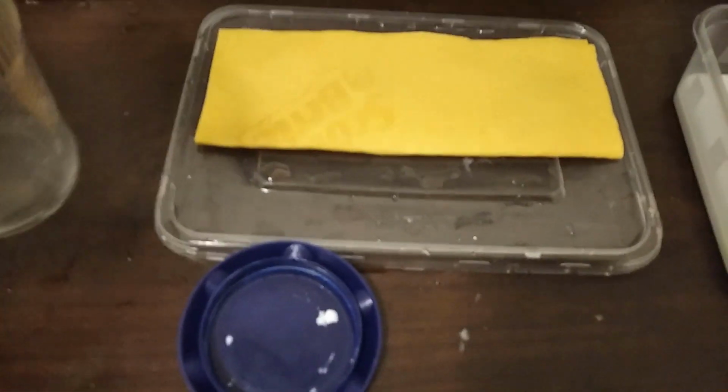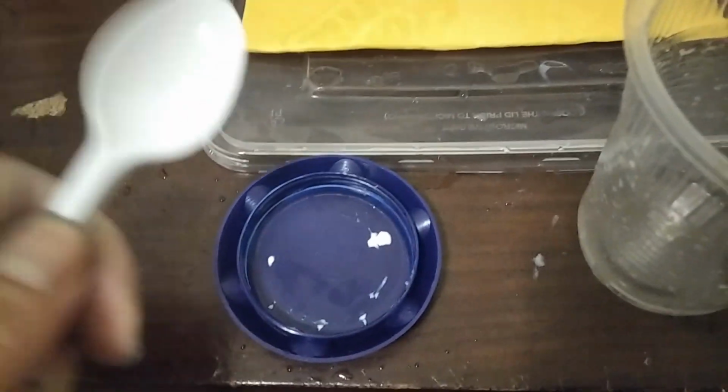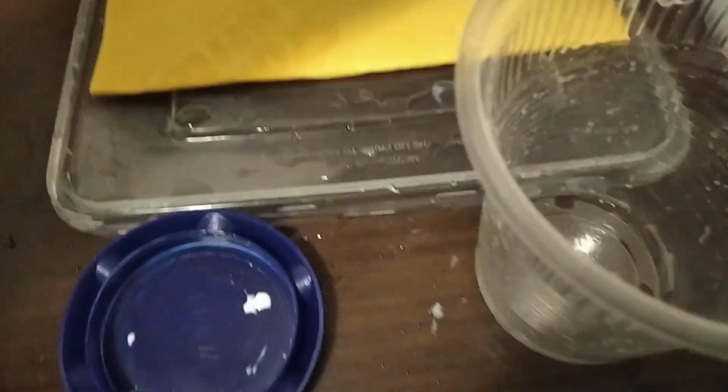Today we are going to make the ion exchange membranes. So you see, we have here some microfiltration cloth. It is also called Scotch Brite, but it is a microfilter. I have proved it based on filtering copper hydroxide.